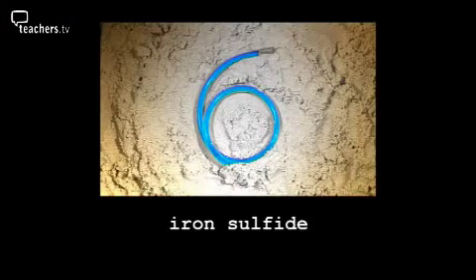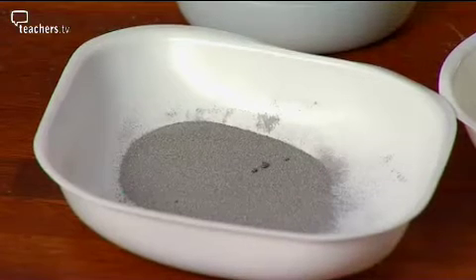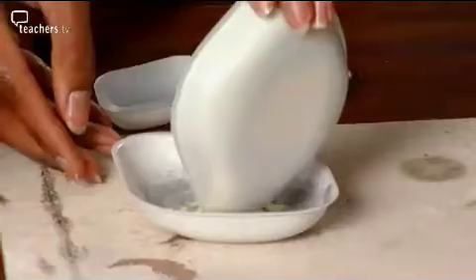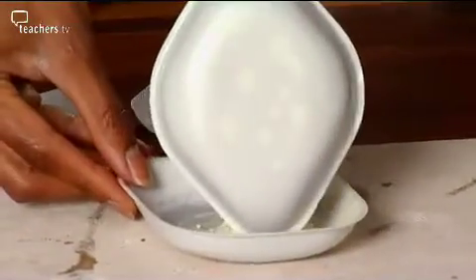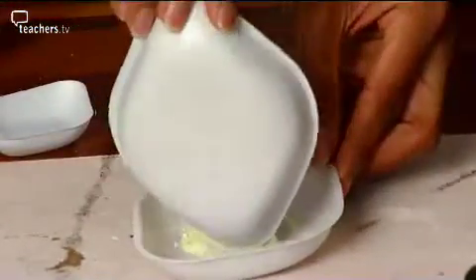At 6, just missing out on our top 5, it's making iron sulfide. What we've got is some iron powder and some sulphur powder. The first thing we need to do is get them really well mixed together. You have any idea why we do it like this rather than grinding? It seems a bit cumbersome. Sometimes if you grind two powders together, you get some heat from the friction. Oh, right. And that could trigger off the reaction.